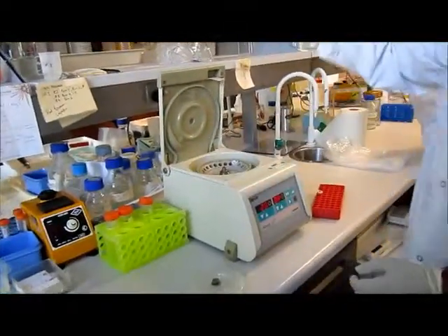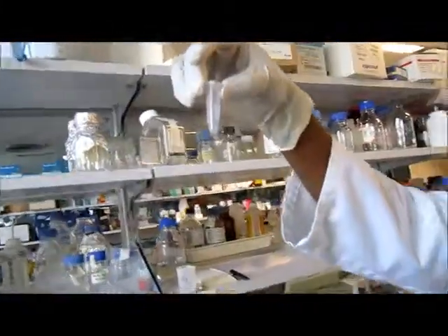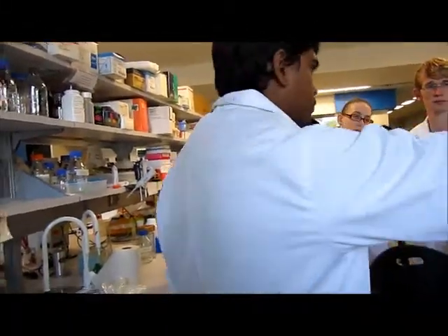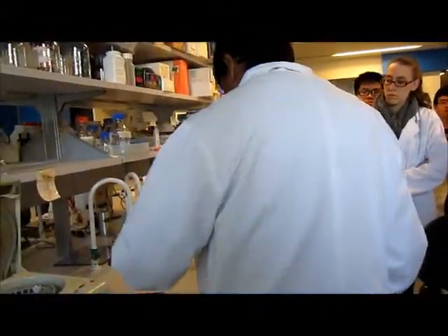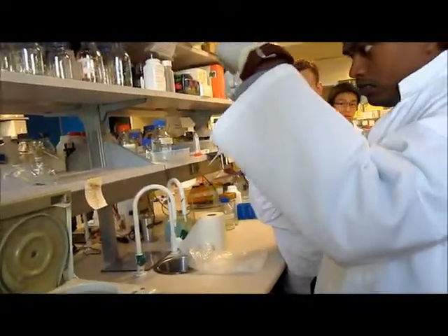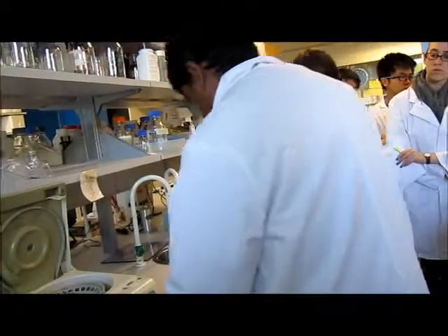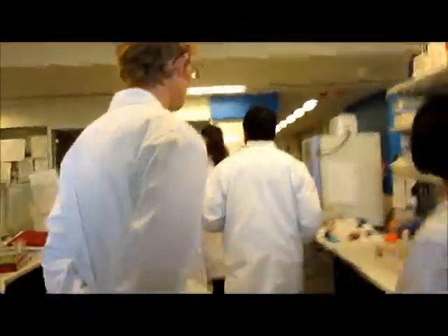Now we need to see whether there is any bubble. It looks like no bubble, right? Well settled at the bottom. So now we can allow them to digest. Why did we need to spin it? Just to settle them at the bottom without any bubbles. Now we'll just put them into the incubator for the next maybe 1 hour, 1 hour 15 minutes.